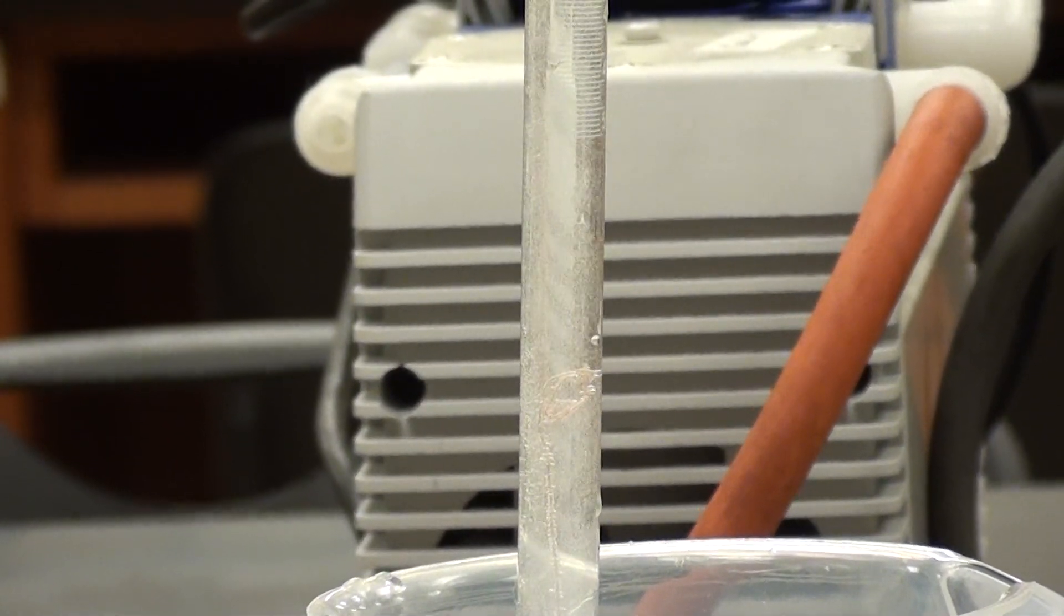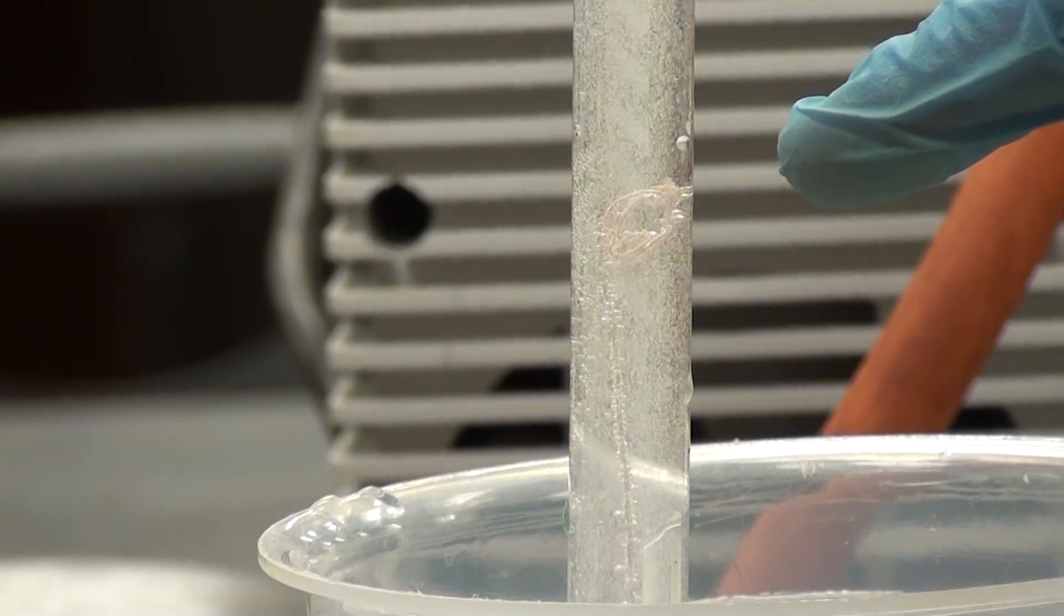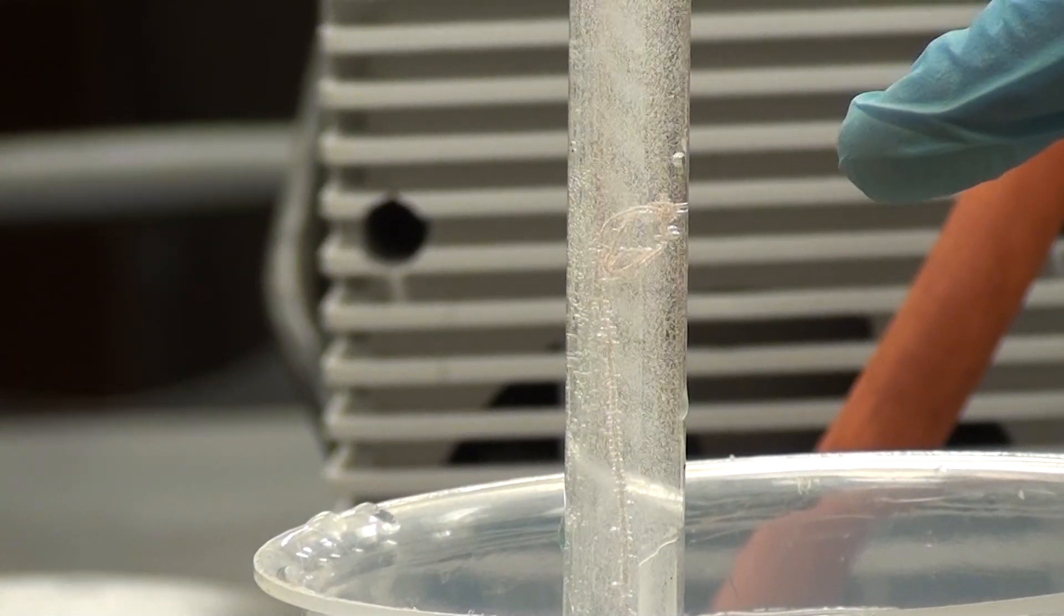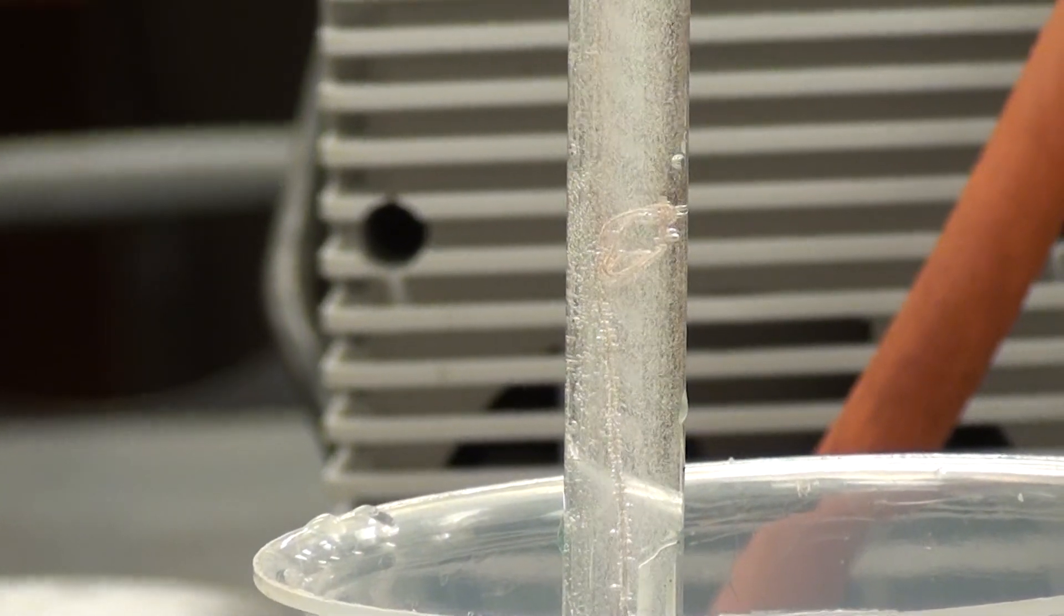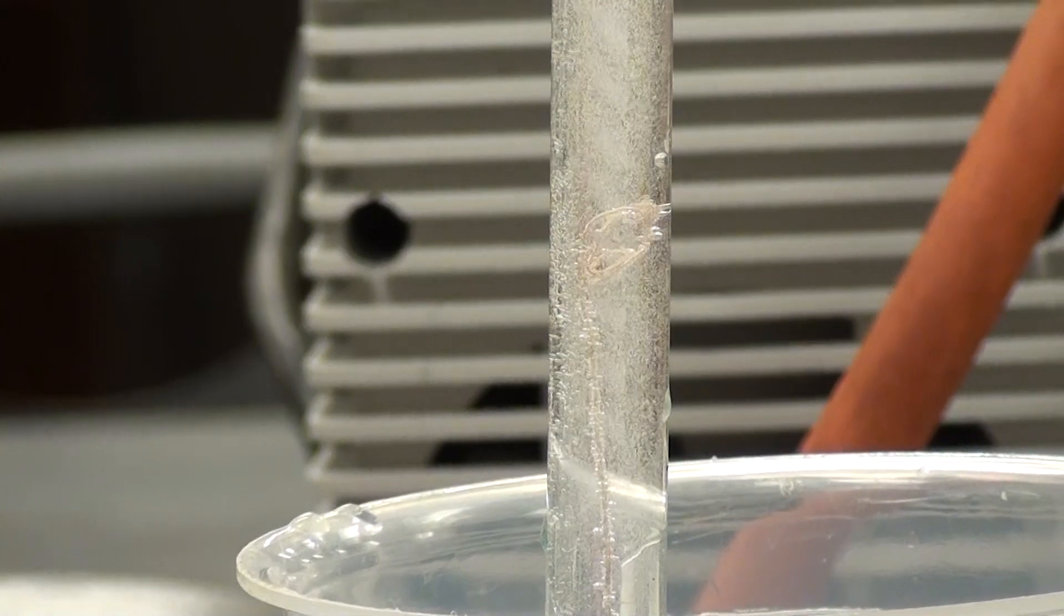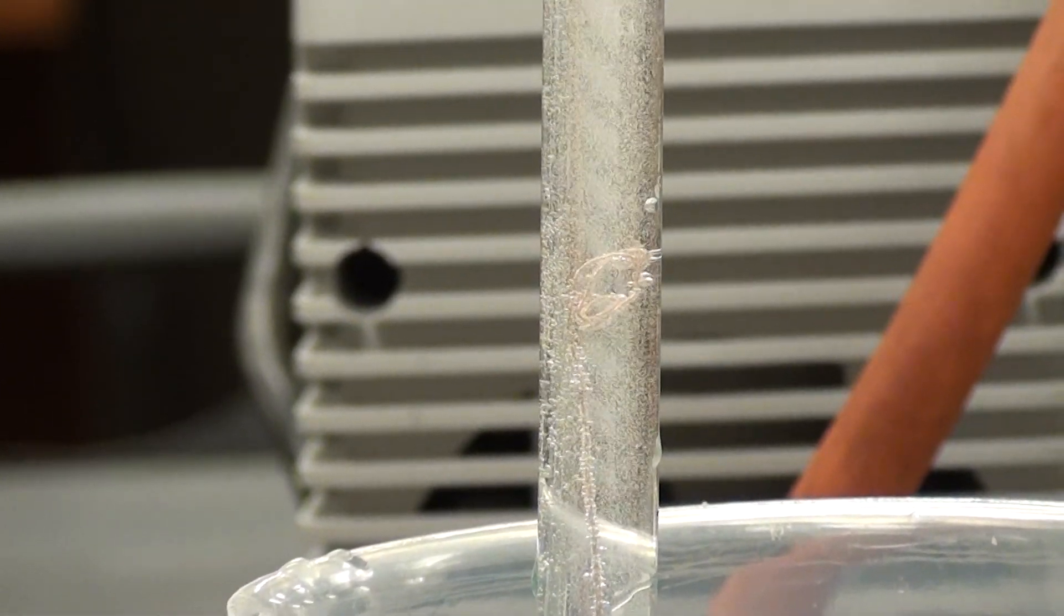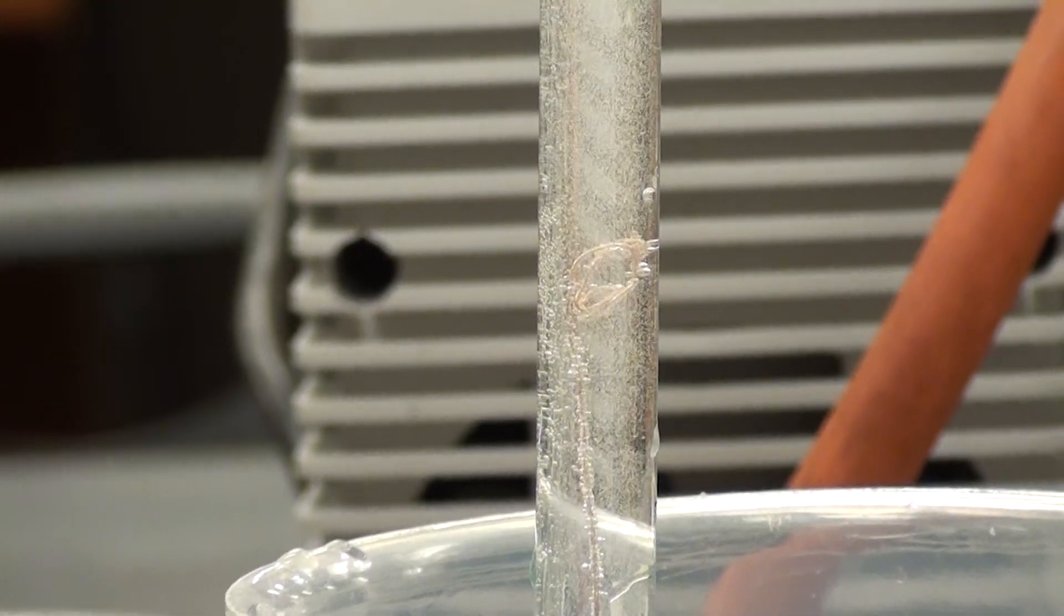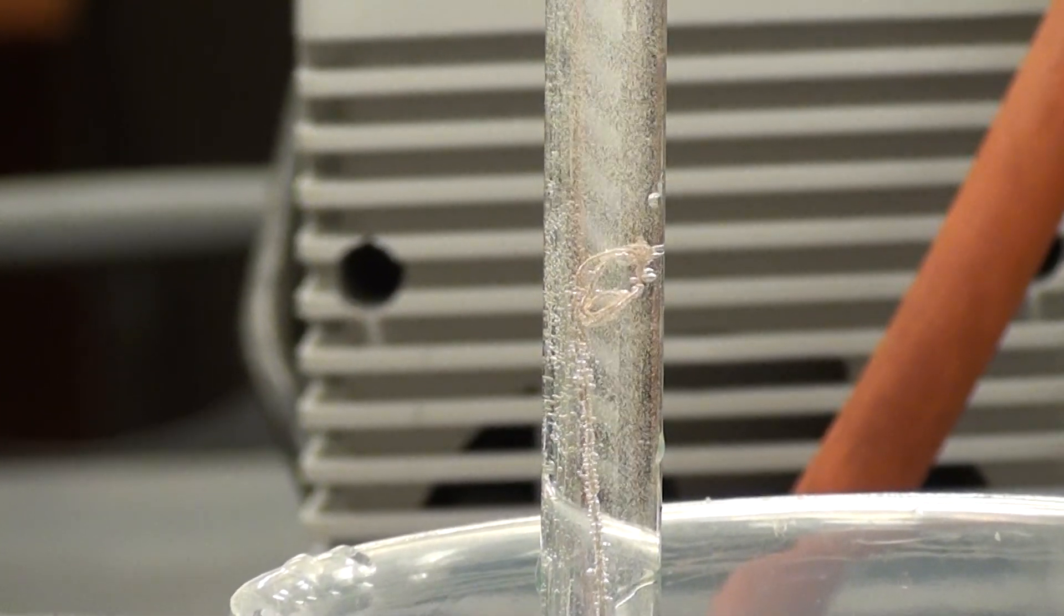There we go. Could you please zoom in on that? Looks to me like the magnesium is completely gone now. And we're in a position of being close to be able to make a measurement. We still need to do one more step here. We need to let this cool for a few minutes. And then at some point after a few minutes it's cooled, we can push this down and equalise the pressure.